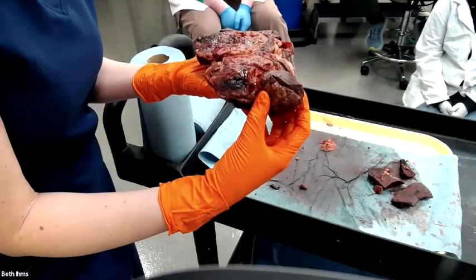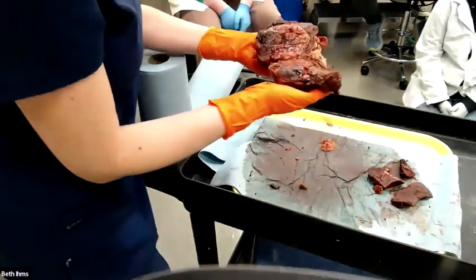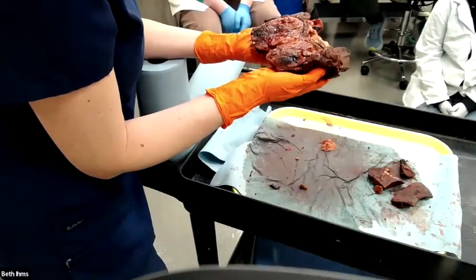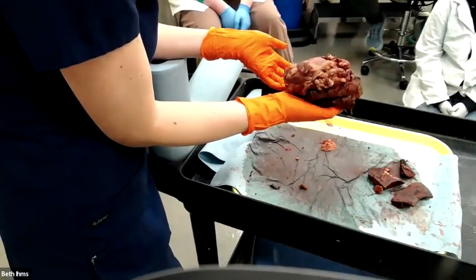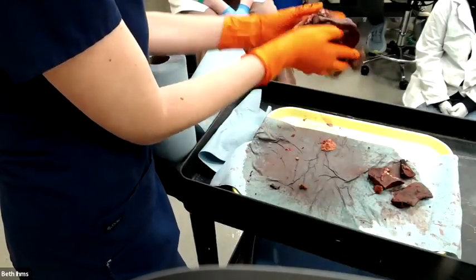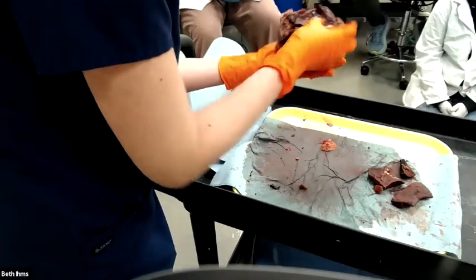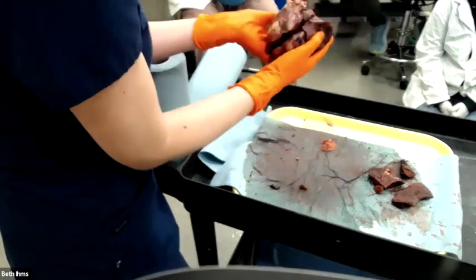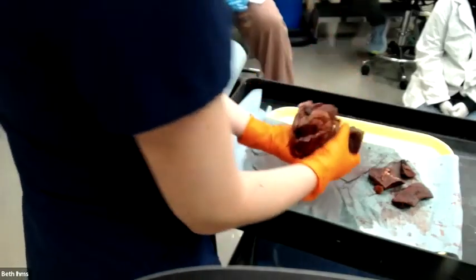So the little nodule outside the main nodule has umbilication, which is an important feature to describe for some neoplastic masses. So that's how I would describe this. This is a hepatocellular carcinoma. I would also describe the omentum firmly adhered to the surface of the mass. I can't tell what percentage of the organ is affected because I don't have the whole organ. We've cut off parts of it because it's a biopsy. They amputated this part, rest of the liver is still in the dog.